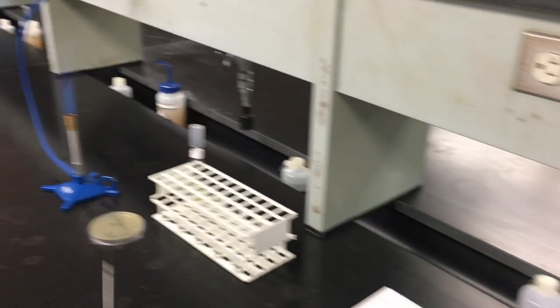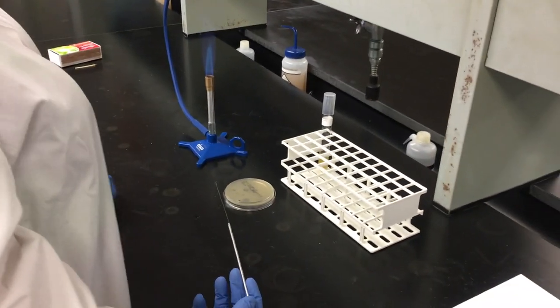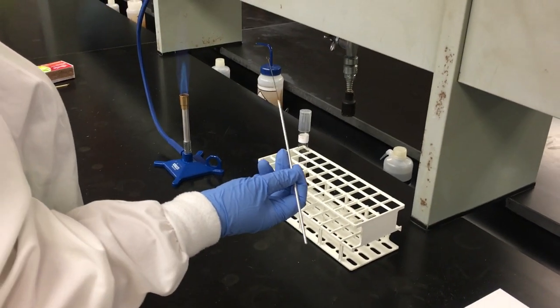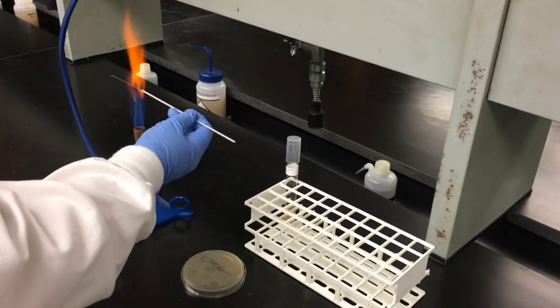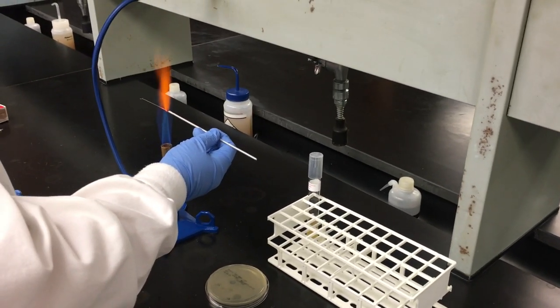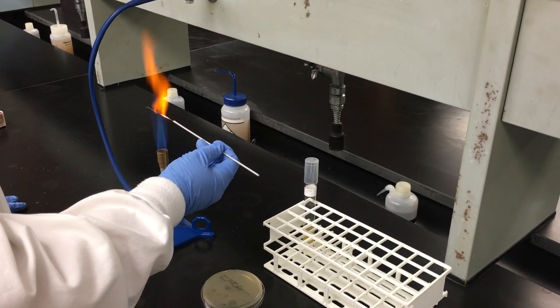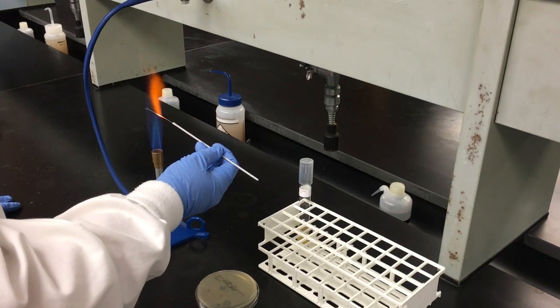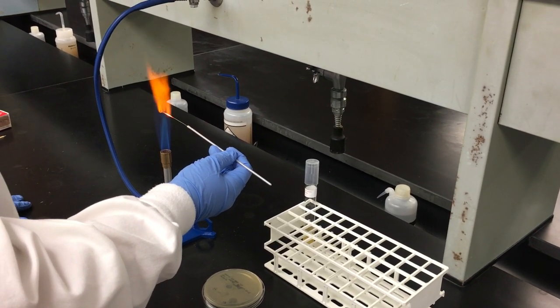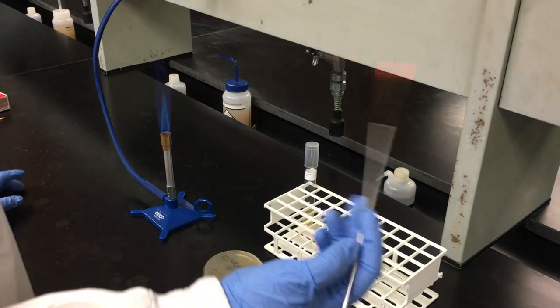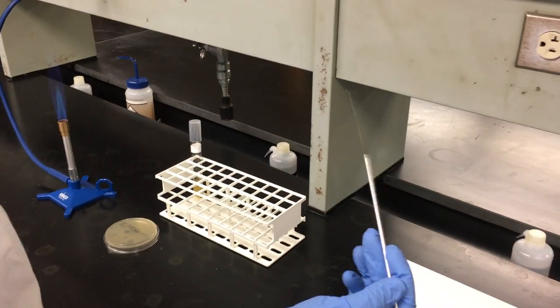Pure culture. We will be inoculating a pure culture plate. We will start by sterilizing our loop from handle to tip. We will then allow for our loop to cool.